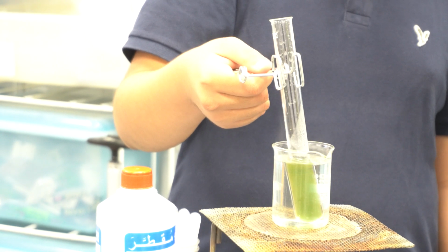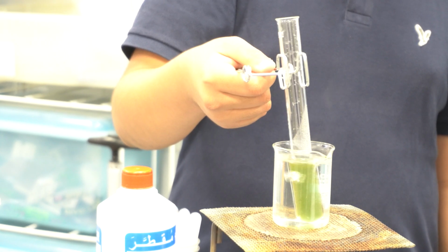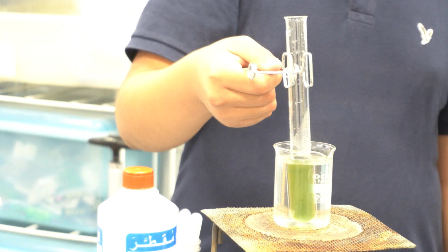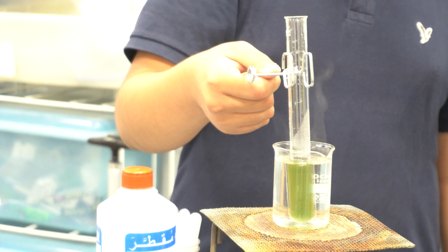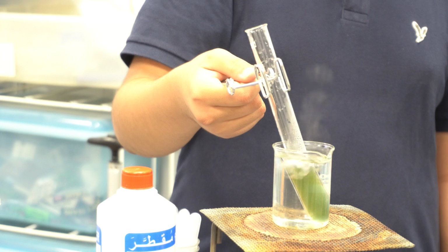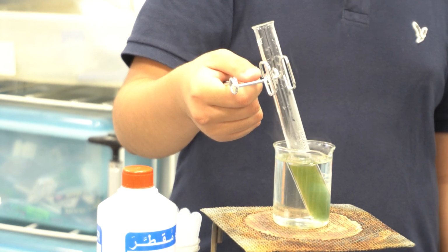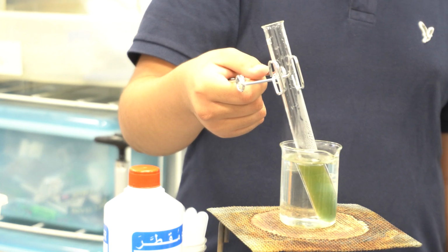No, it's not dangerous, but we have to start with an adequate amount. You got it? If it's too hot, it will break the beaker. The beaker is made of Pyrex, which is a highly manufactured glass made to withstand extreme temperatures. I can place it for an extra couple of minutes, but in order not to keep you behind, I think that now is sufficient for the test, because you have a class.